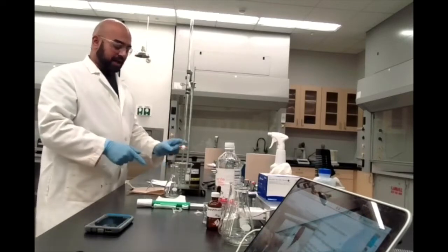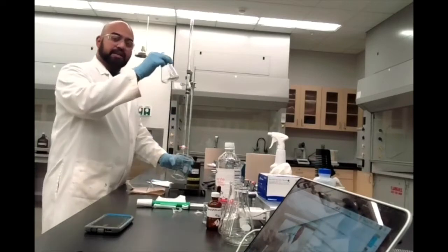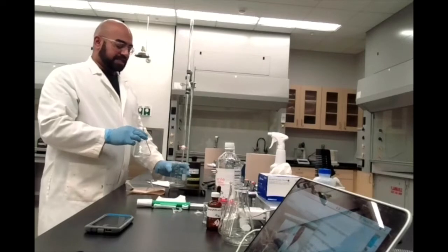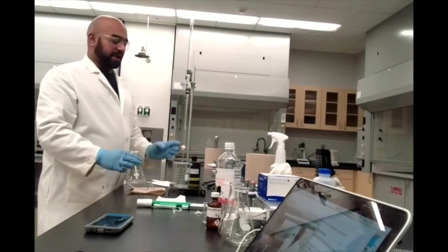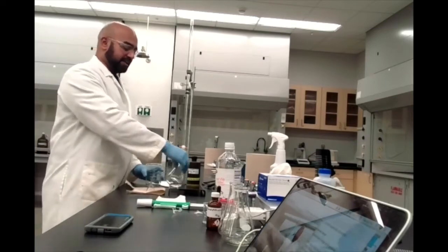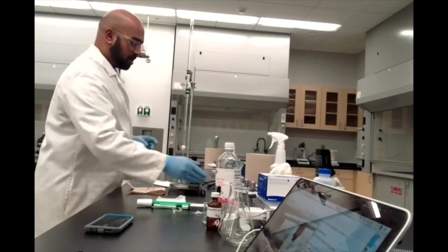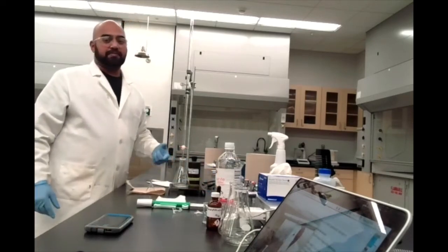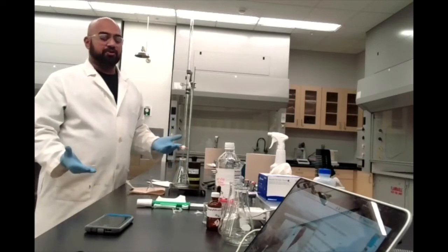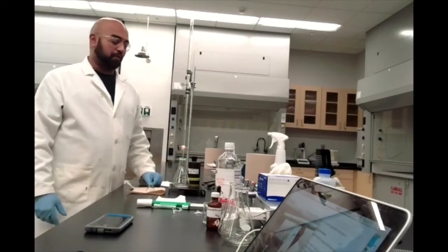I want to swap out this beaker, now that I've gotten rid of my air bubble. I want to add my Erlenmeyer flask in here. If it's easier to move things out, you could just raise and lower this burette, or you could tilt whatever you're removing or adding and put it in like that. Again, you don't want your burette too far down. I mentioned you don't want any splashback onto your burette. It's just going to contaminate your burette and probably influence further trials, which we don't want.